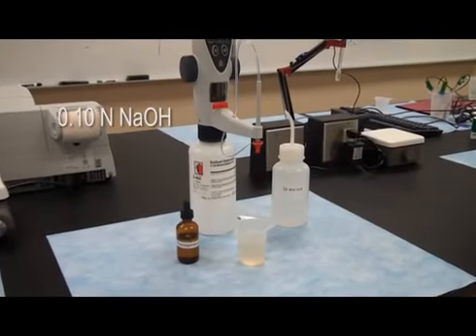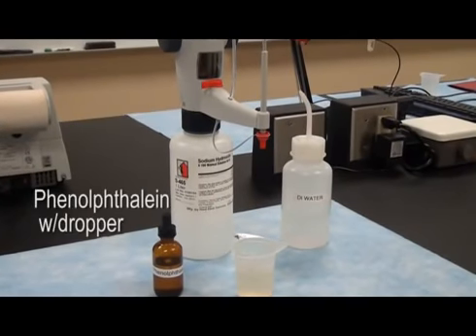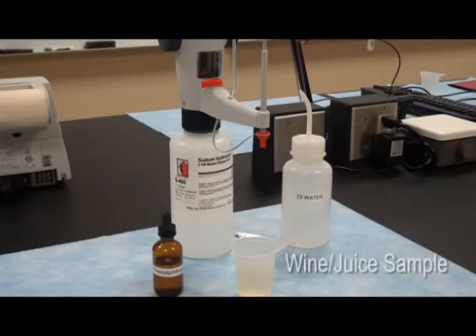Supplies: 0.10 N sodium hydroxide, phenolphthalein with an eyedropper, distilled water, and a 5 ml wine or juice sample.